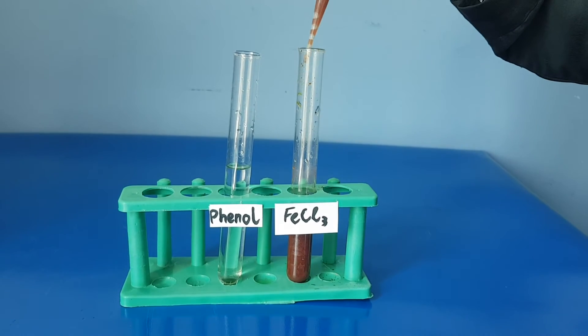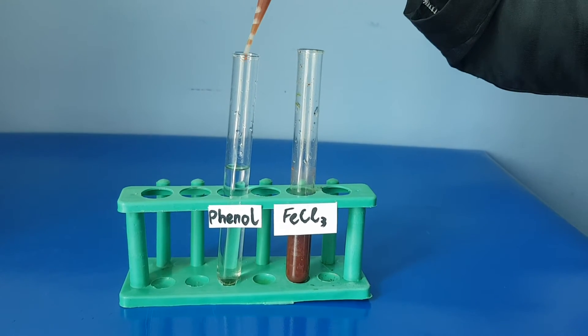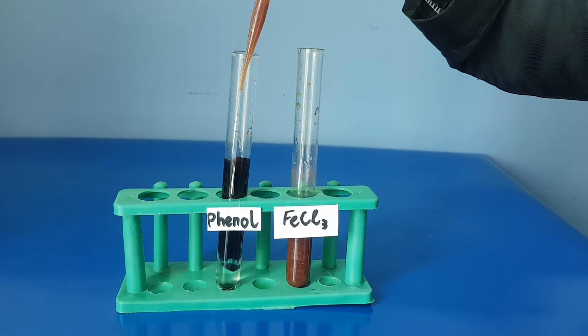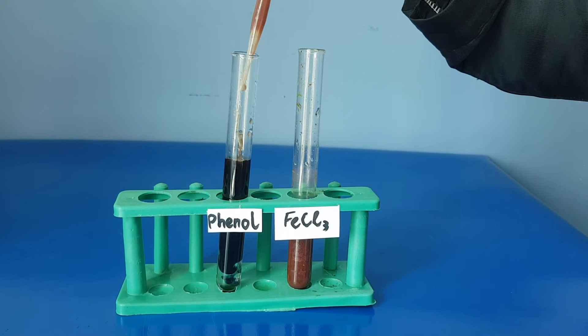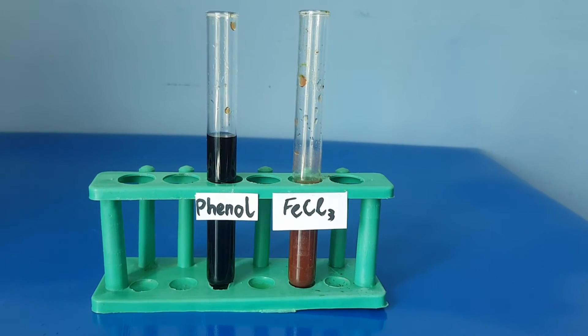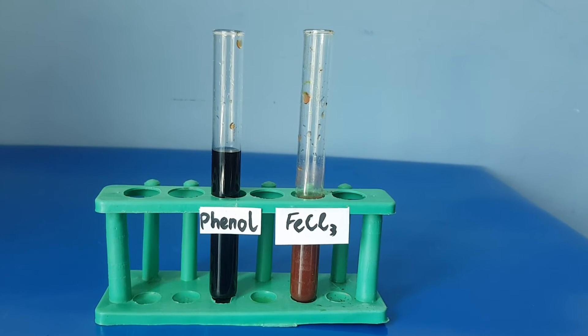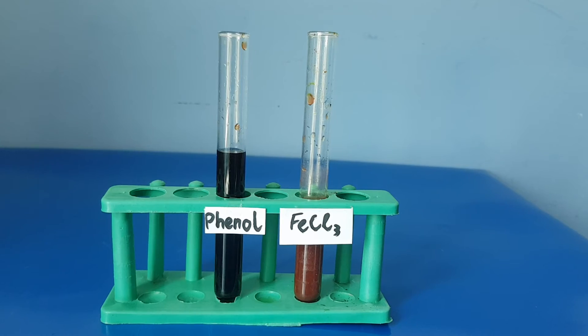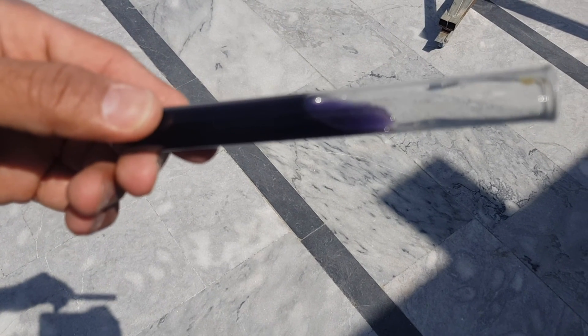Now add ferric chloride into phenol. The color of phenol has turned into a dark purplish color — it is purple.